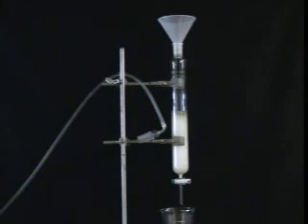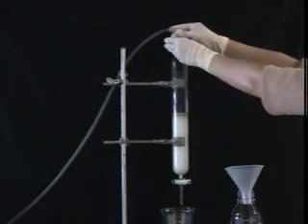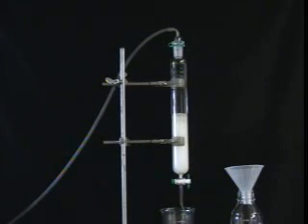CAUTION! Never discard any fractions until you recover the desired material. It is a good idea to clean up the silica before you discard it in the appropriate waste container. When you are sure that there is no more desired material on the column, fill the column with ethanol, place a flask underneath, and push air through the column until the silica is dry and free-flowing. At this point, it will be easy to discard the silica by pouring it into the proper waste container.